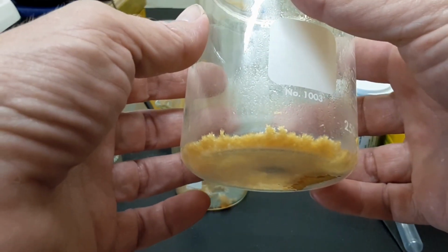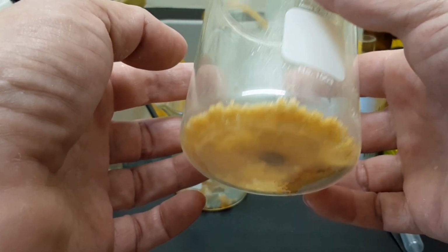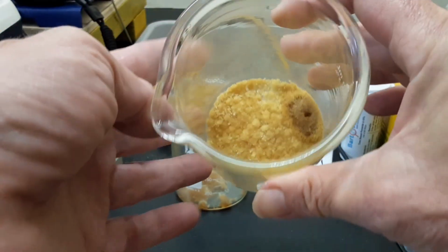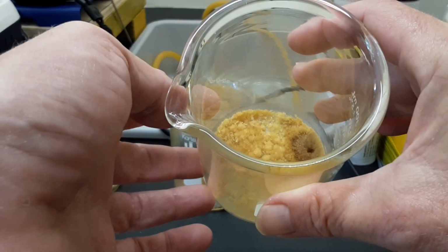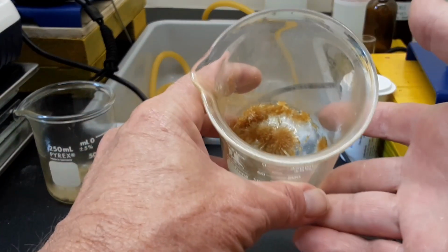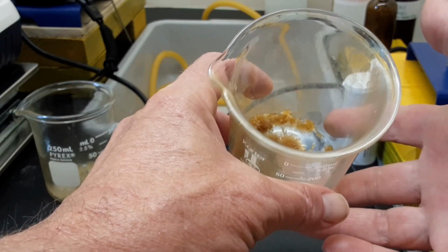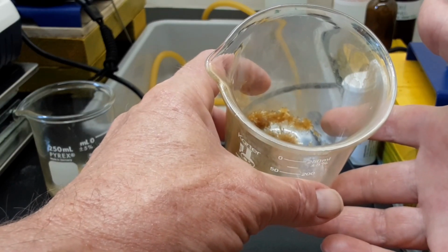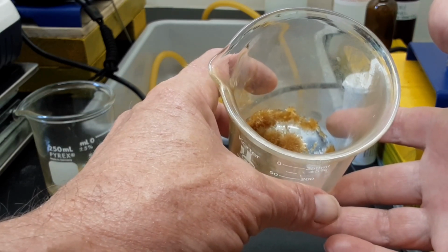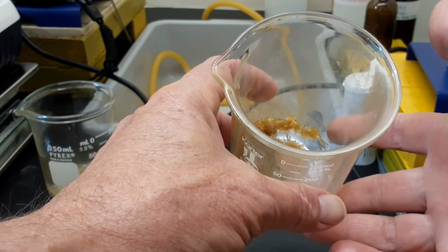This one here was 200 grams of white pepper, same exact stuff. This was done in isopropyl because I ran out of ethanol. The reason I ran out of ethanol is because when I tried to distill off the ethanol from this, I started getting stuff coming over at like 130 degrees, 140 degrees. The temperature just kind of started going up slowly in a linear fashion. It never really did approach the boiling point of ethanol.